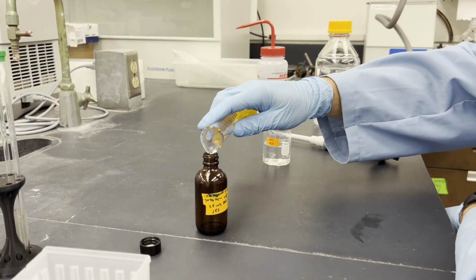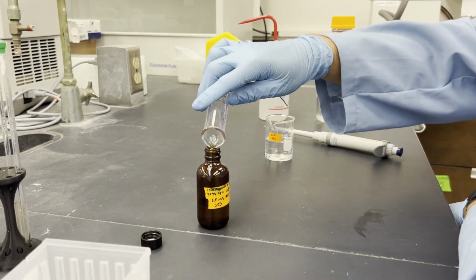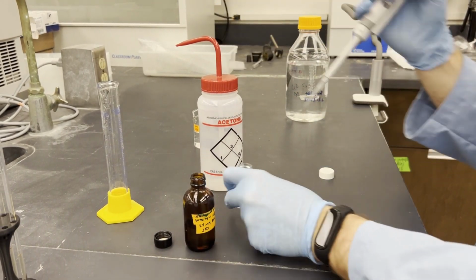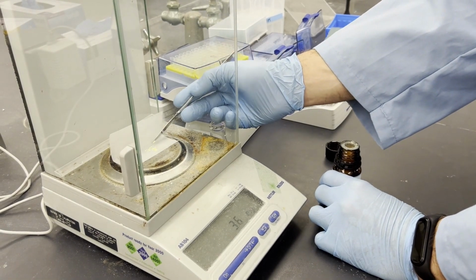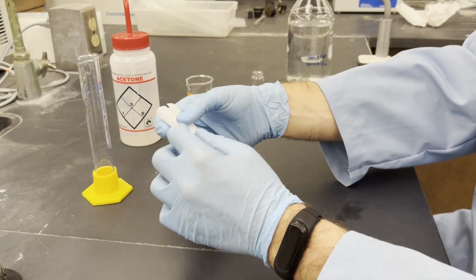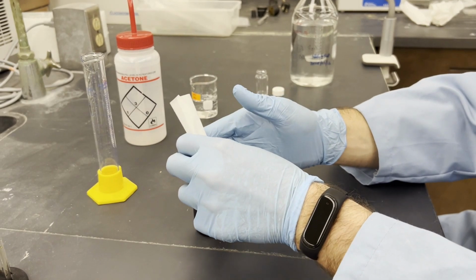You'll need both a grad cylinder and pipette for our measurements. Acetone tends to evaporate rapidly even within the pipette tip, so be swift when adding it or it will drip out onto the counter. The reagent tends to clump up and stick to everything, so I recommend adding it towards the edge of the weigh paper and be careful when adding it into the bottle. Definitely don't worry about camera angles for this one.